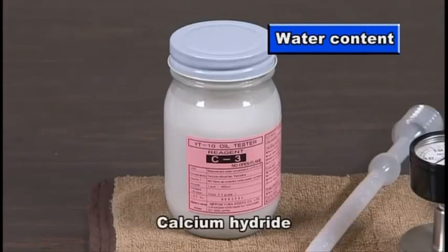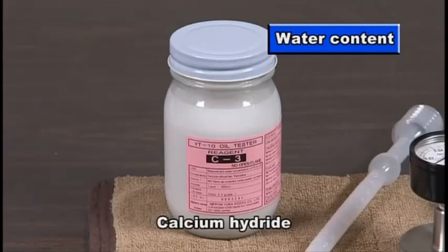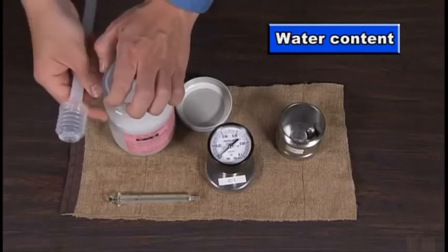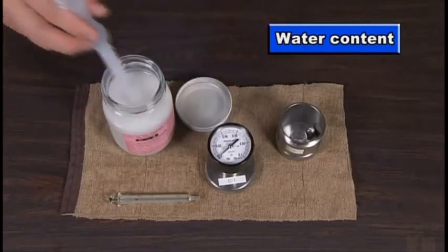Measure water content. Put a reagent that reacts with water and generates hydrogen in a container.